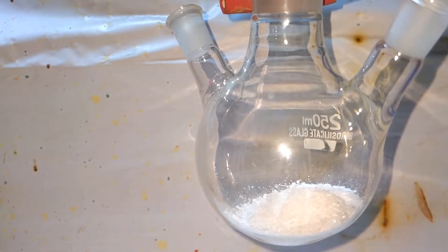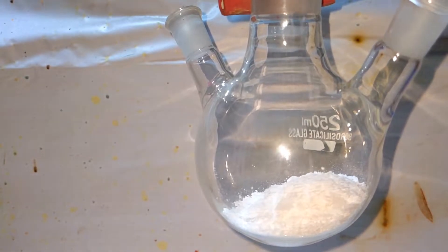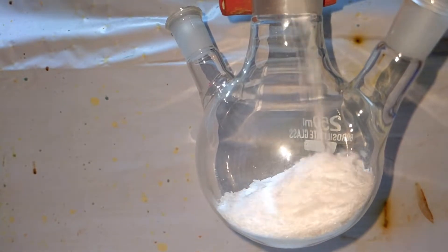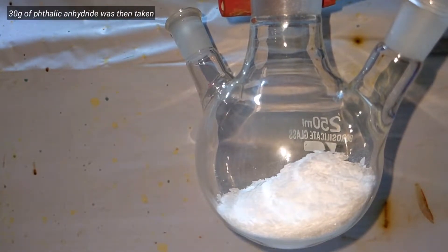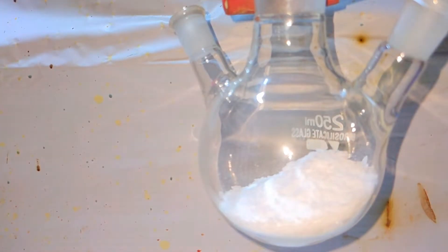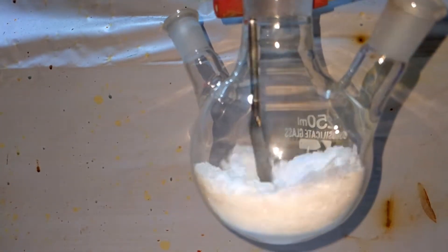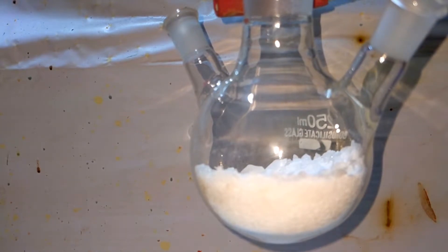On top of that was added 30 grams of phthalic anhydride. Here is where I made a mistake. Whenever you do a phthalein dye reaction, always grind both the phenolic compound and phthalic anhydride thoroughly in a mortar and pestle to a fine powder. Here I am just swirling the flask and trying to desperately mix them together with a spatula. This greatly reduces the surface area of the reactants in contact and greatly reduces the yield.